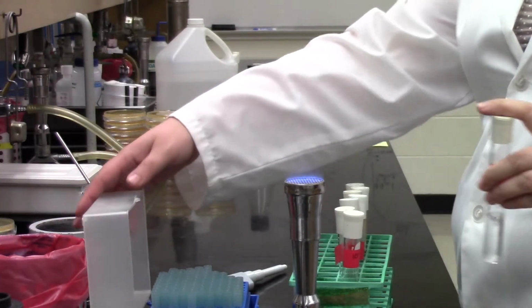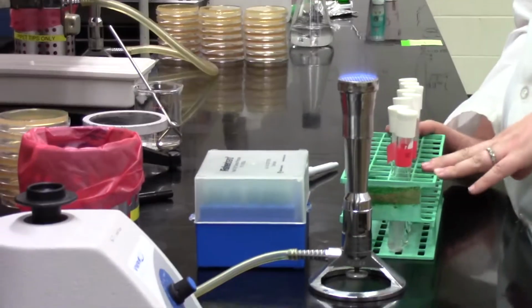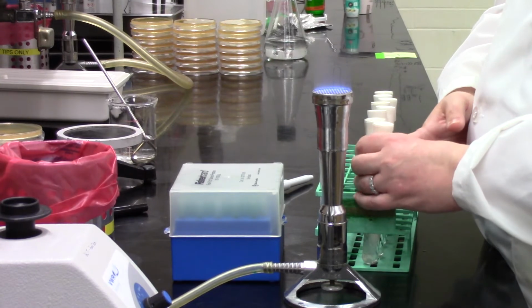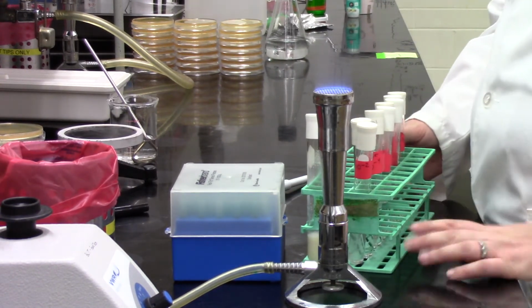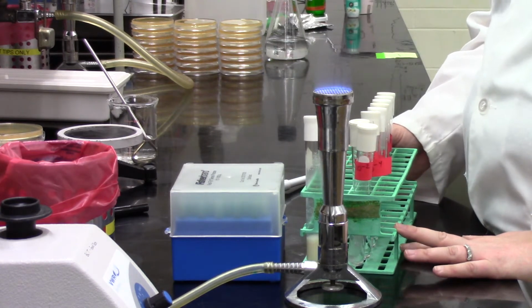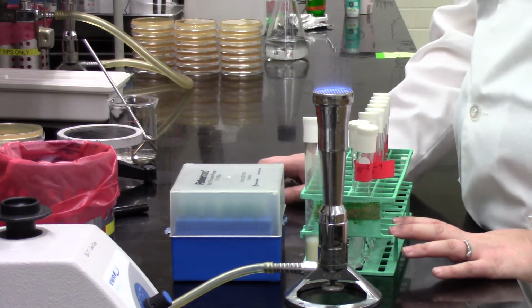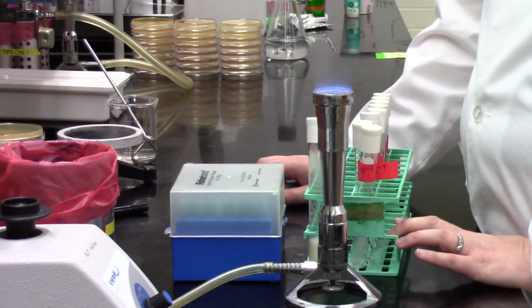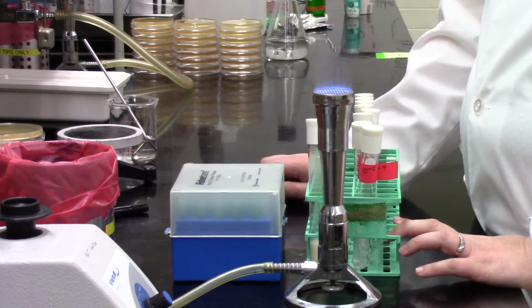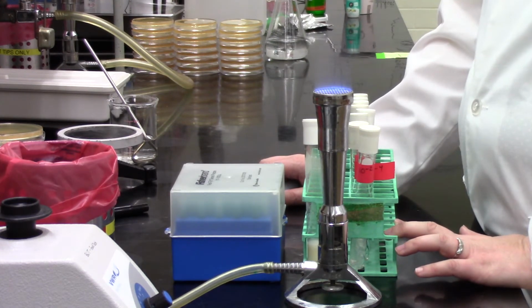And there we go. We have our full dilution series. You can see how Sabrina's really careful to close up those pipette tips as soon as she's done. So those stay closed until you're ready to start working. That pipette box stays, when it's open, right in the sterile zone, because you're protecting those pipette tips as well, right, from any environmental microbes settling onto them. And they've been sterilized before use so that we're ready to go, and we're making sure we have just bacteria from that probiotic capsule in our sample.